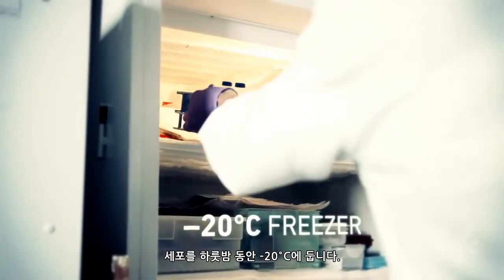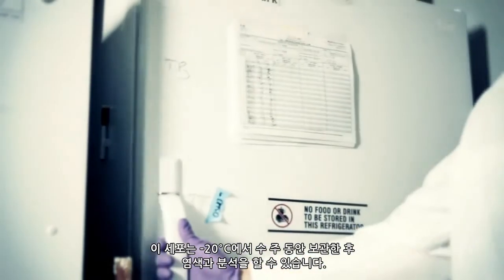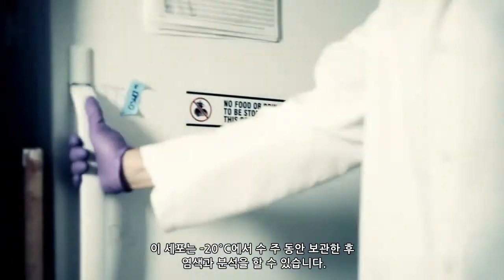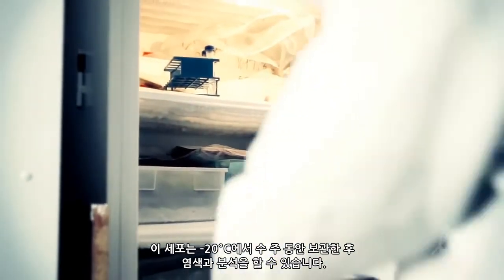Place cells at minus 20 degrees C overnight. These cells can be kept for weeks at minus 20 degrees C before staining and analysis.